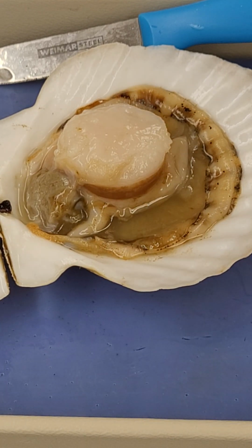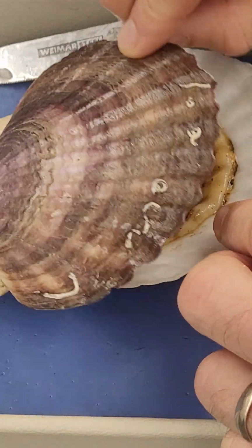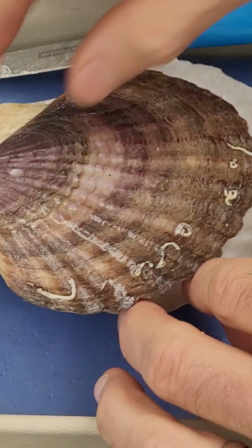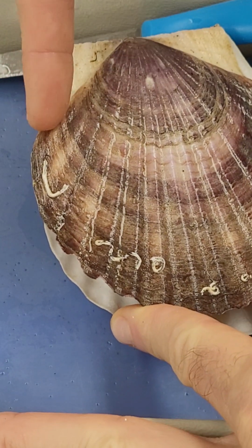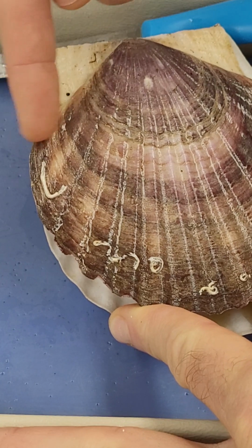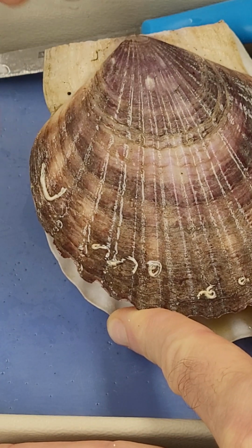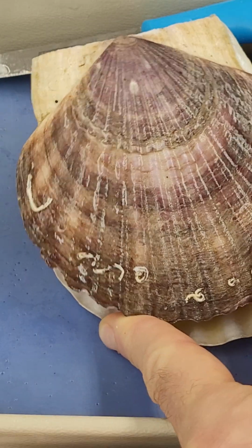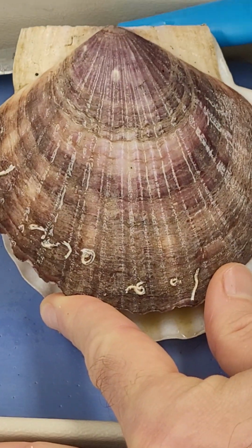Okay, so here is a scallop dissection. If I were to close this, you'd see that this would have been a hinged organism. The way to orient it is to see that you have a slightly convex area to one side of the umbo and a concave area to the other side. The slightly more concave area is the anterior side, and the convex is the posterior side. So this would be the dorsal point just here.